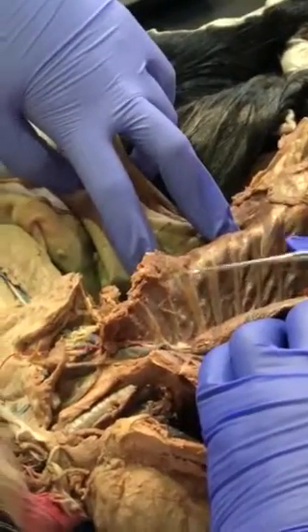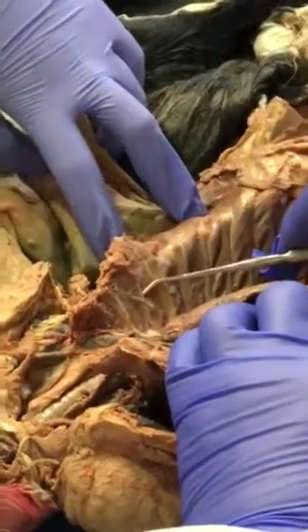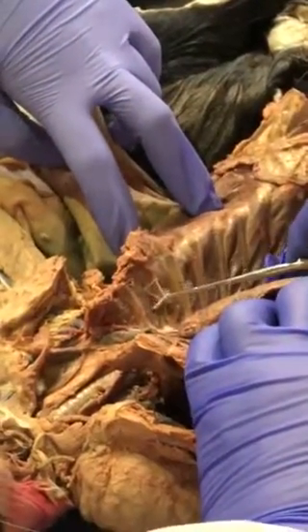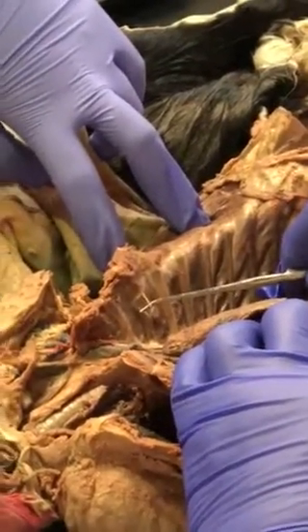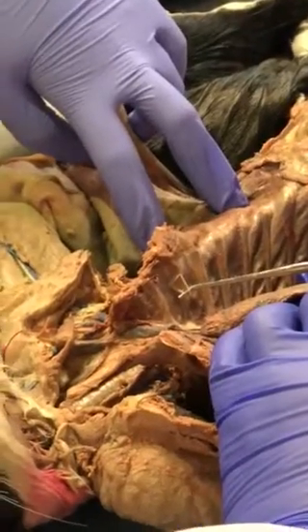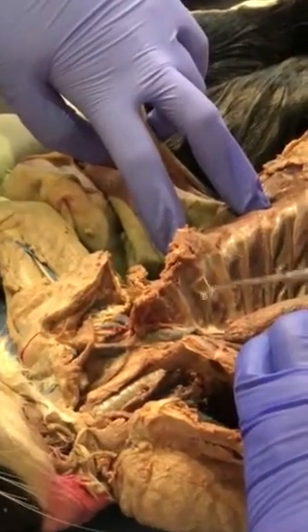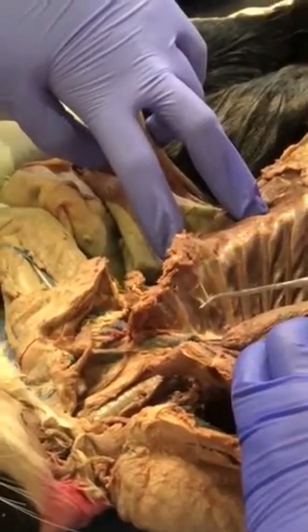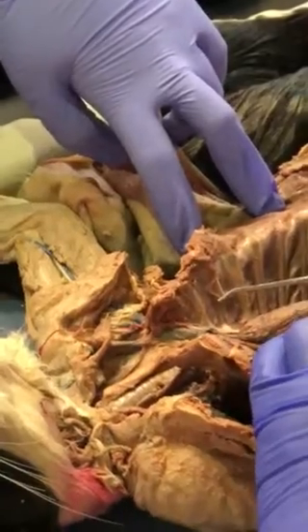You see this white thing? Even if it is like a fine one like that, Professor Bastido can always attach a string to it, so he always asks that. Now we go down.